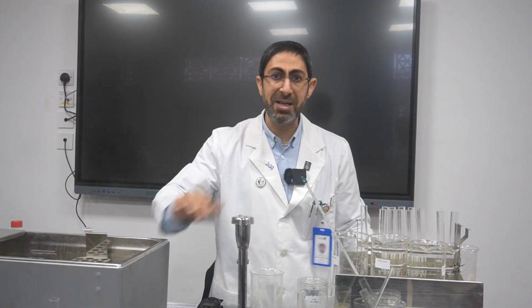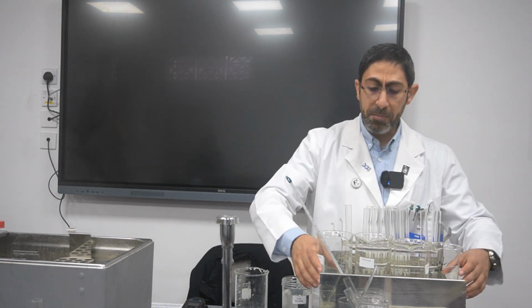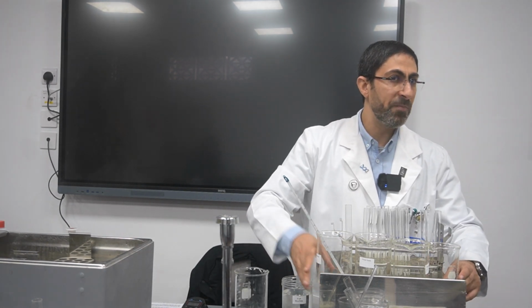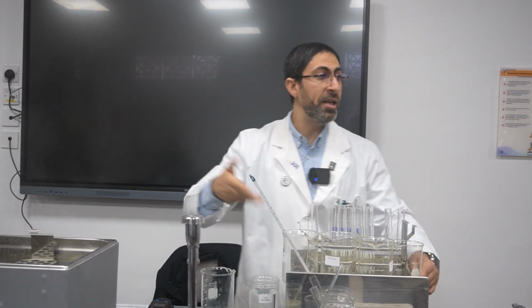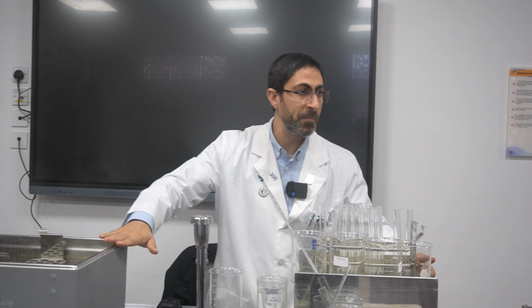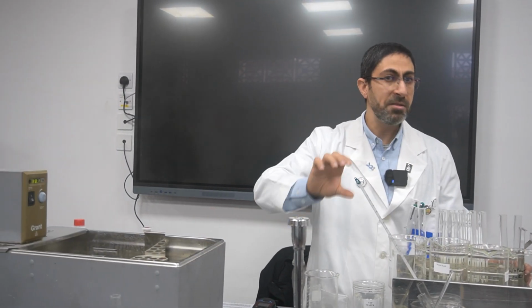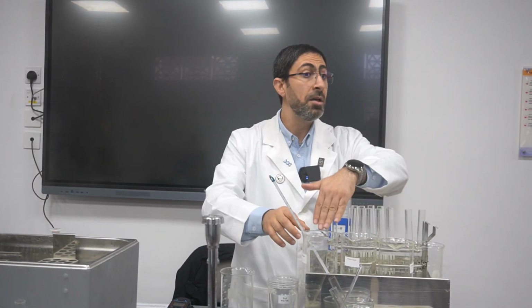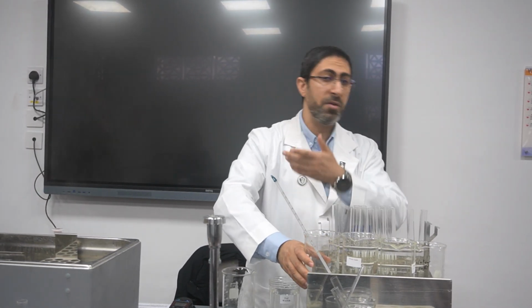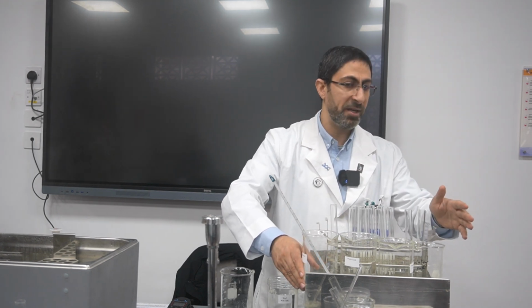So I will use a different procedure to clearly give you this demonstration: I'll start with the highest temperature, and then decrease the temperature, because it's easier for me to handle outside of the thermostatically controlled water bath. I can even have separate Bunsen burners, each with a separate beaker at a temperature that has to be maintained, which is perfect as well.